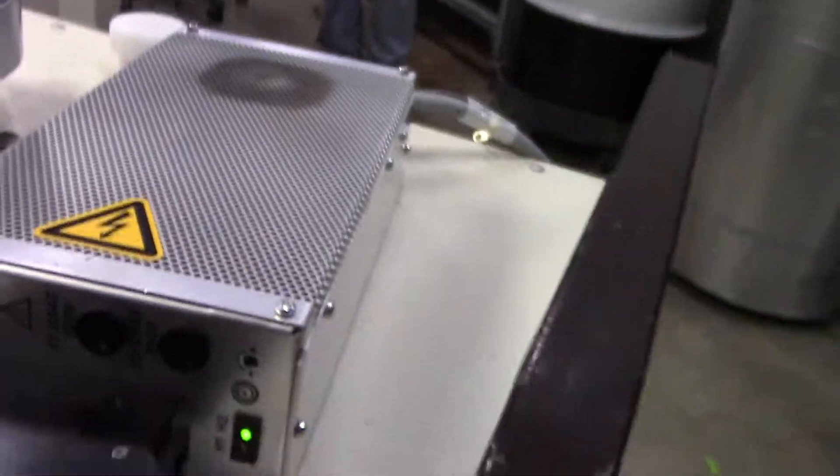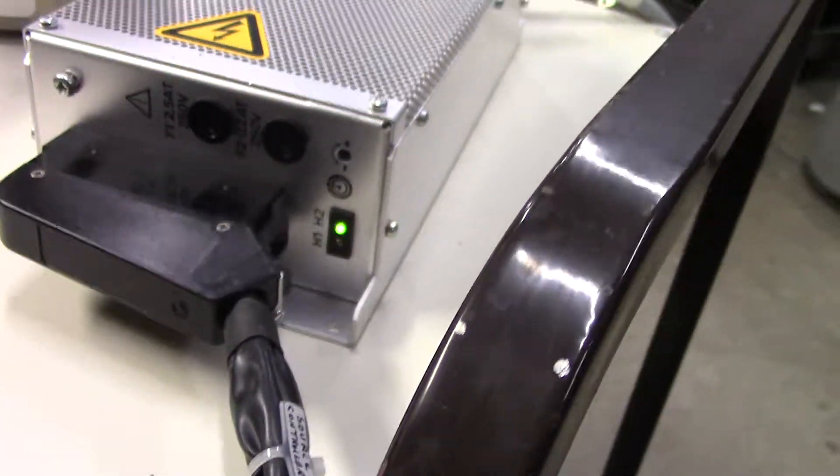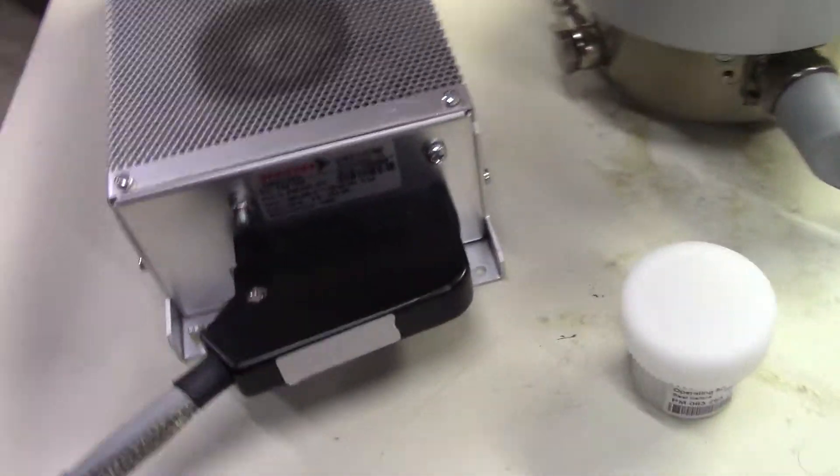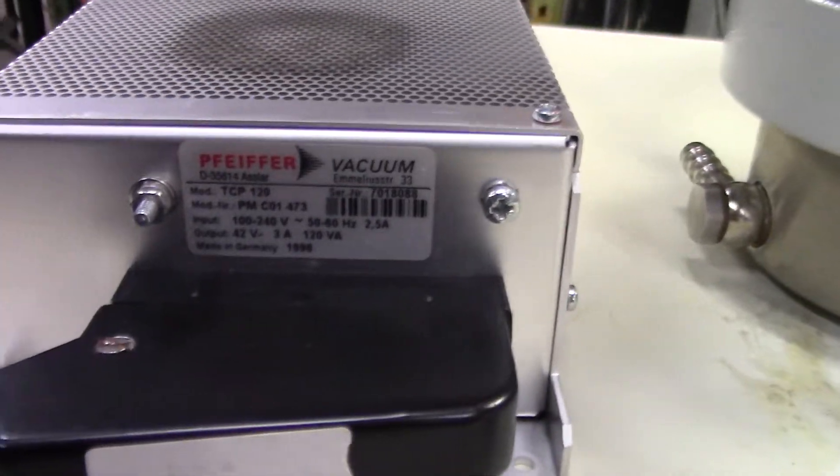And here's the turbo controller. You can see it's at H2, which is full speed in the green. Here's our turbo controller.